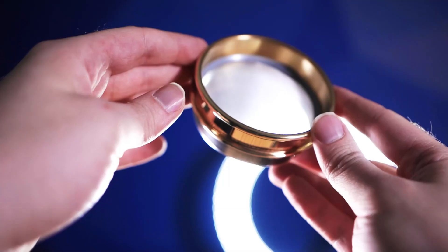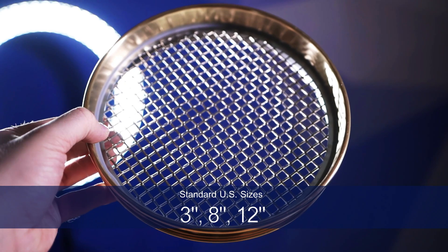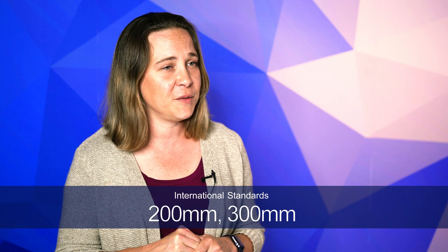The frame is usually a round metal circle that holds the mesh in place. The standard frame sizes in the U.S. are 3 inch, 8 inch, and 12 inch. Internationally, 200 millimeter and 300 millimeter are the standard sizes. Some frames can be made out of stainless steel, brass, or even wood.